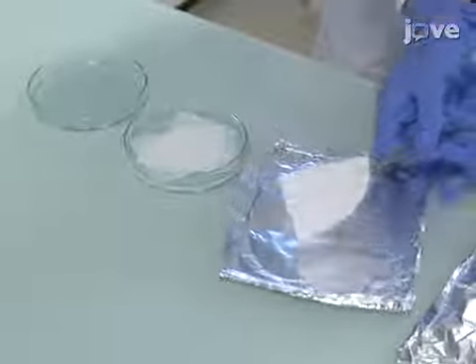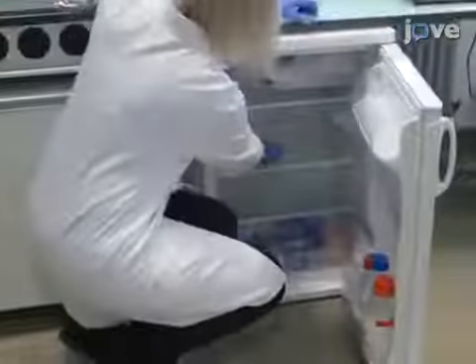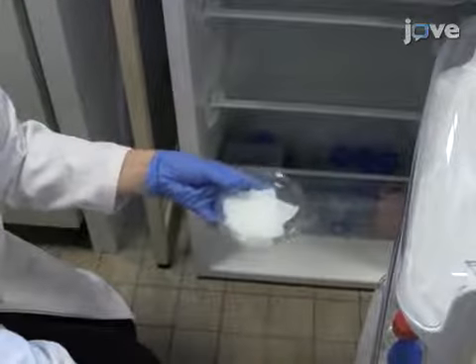First, immerse a previously prepared filter sample in ultra-pure water for 2 hours at 6 degrees Celsius in a closed glass petri dish. Every 30 minutes, shake the petri dish while holding it flat.